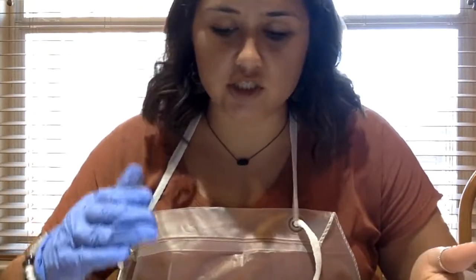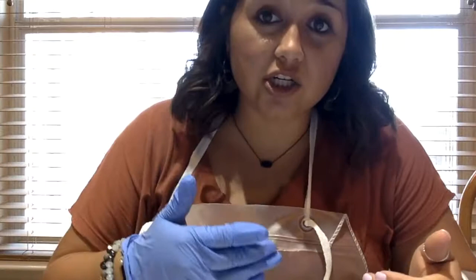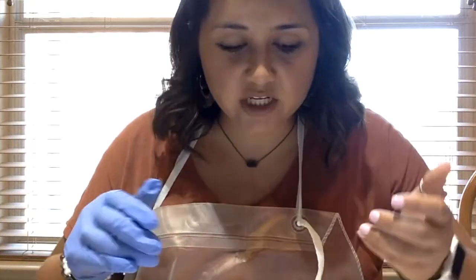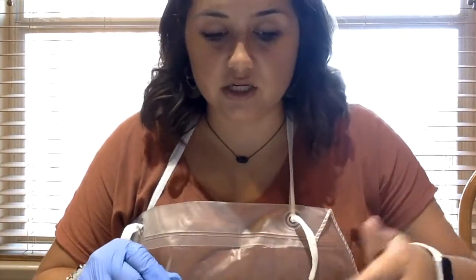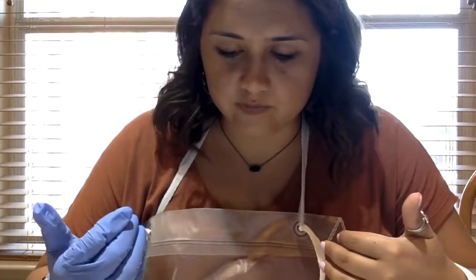And so I took the first dilution from the undiluted, and the second from the first, and the third from the second. And so each color, I had to add in a little bit more indicator to kind of brighten up the color so I could really tell if there was much change. And there's a significant change between the third and the fourth. Well, actually the first and the second too. The second and the third are kind of about the same, but the last one was a significant change.